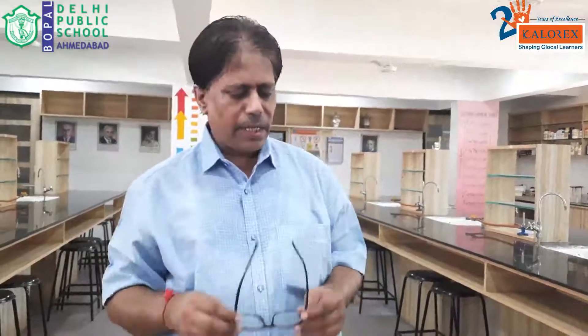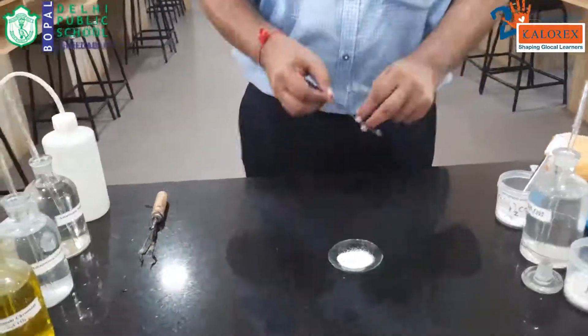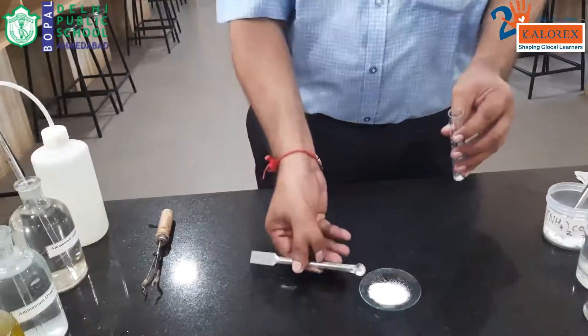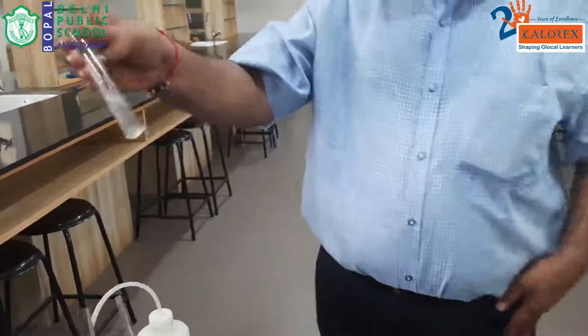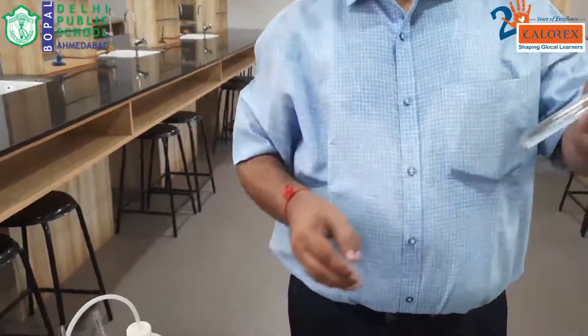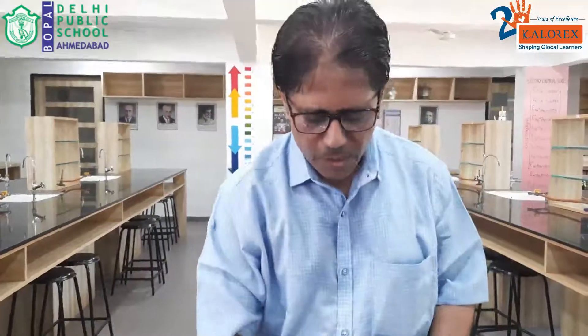There is no smell, so write that inference. Then let us check the solubility of the salt. We take a pinch of salt in a test tube and add distilled water. When you add distilled water, you get a clear transparent solution, which says the salt is completely soluble in water. For a soluble salt, the inference is that nitrates and ammonium salts may be present.